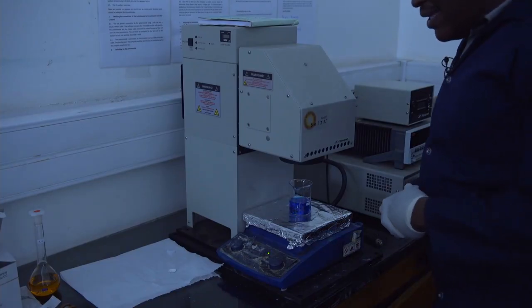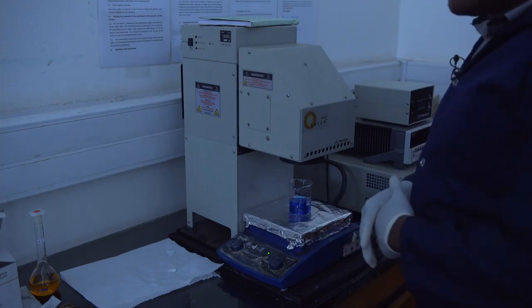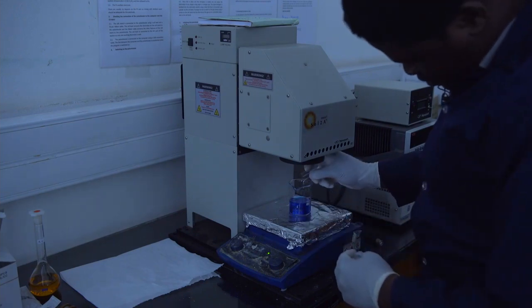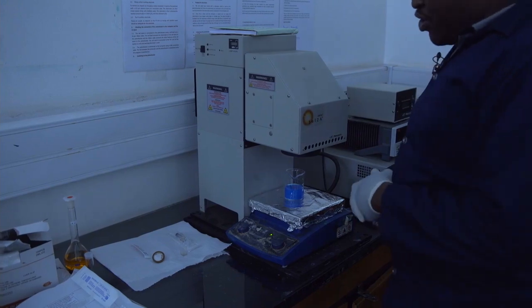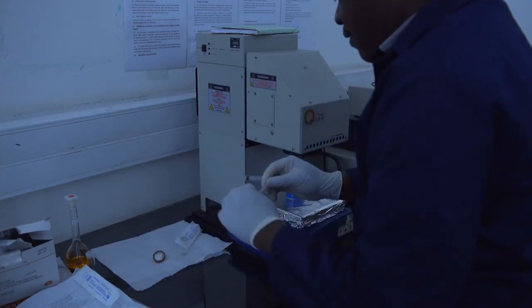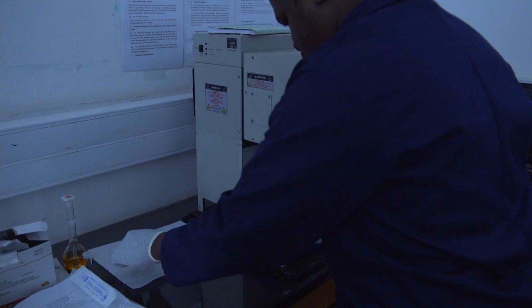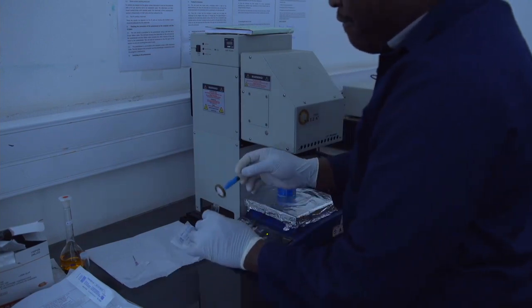After determining the intensity of the 20 ppm methylene blue solution from the UV-Vis spectrometer, we move on to do the equilibration experiment. We add 100 mg of the zinc oxide photocatalyst into the aliquot of the 20 ppm methylene blue. This experiment is done for 20 minutes in the dark. After the 20 minutes' equilibration, we take an aliquot of the sample for UV-Vis analysis. A microfilter is added to the syringe to filter out any residual zinc oxide photocatalyst before the UV-Vis analysis.